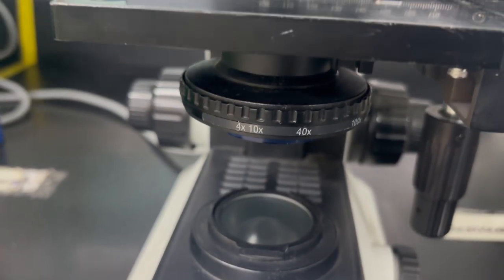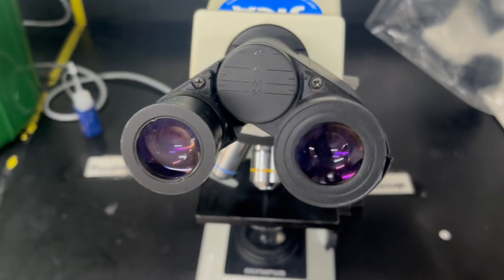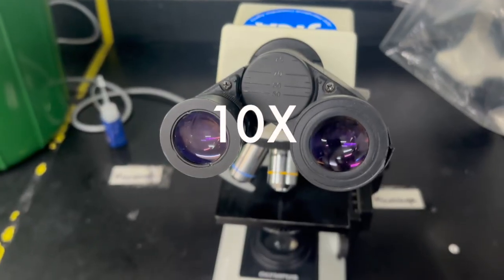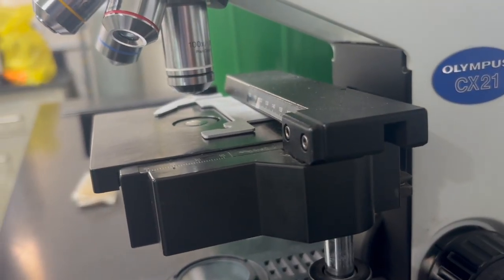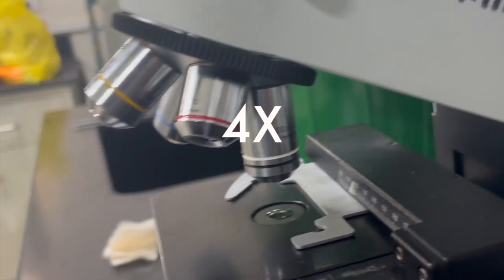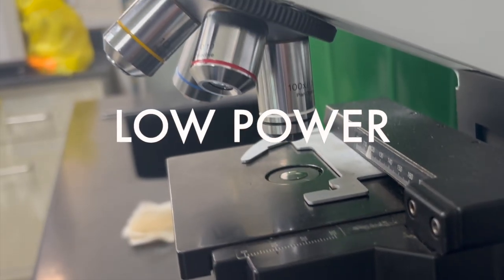So obviously a microscope will magnify your image. So specifically, what is it doing? Right at the top, your eyepieces or ocular lenses, they will actually magnify your image 10 times, just right off the bat. And then you have these nose pieces, the revolving nose pieces, where you have 4 different objectives. So the lowest one is a 4x objective, and this one is generally referred to as a scanning objective. Then there is a 10x objective, which is your low power.